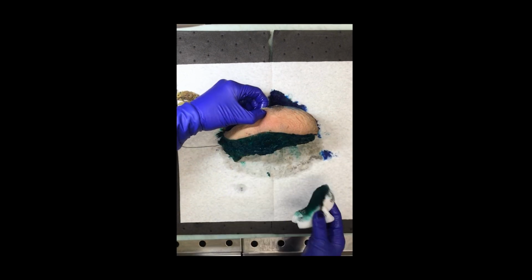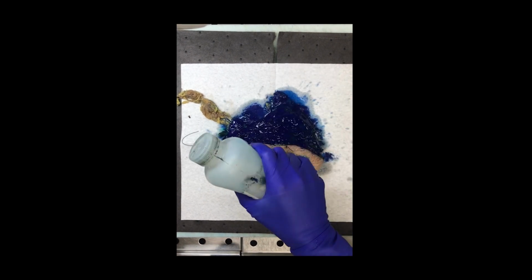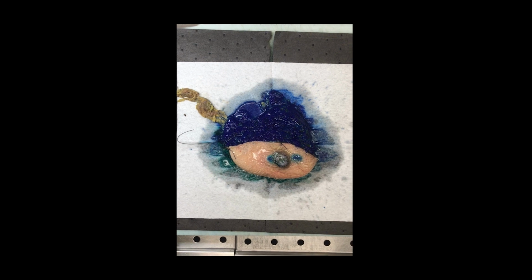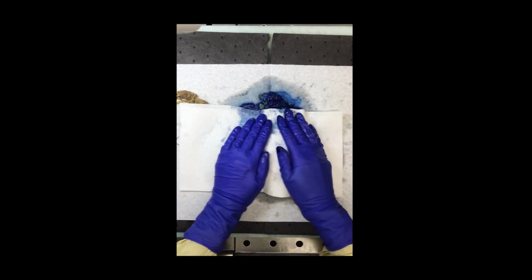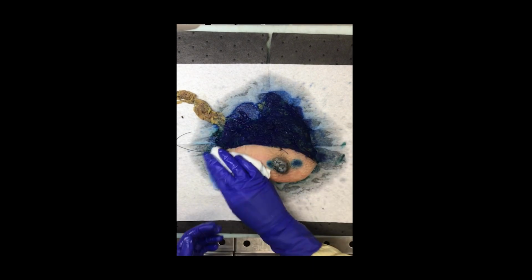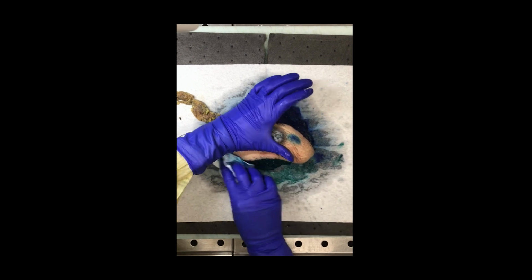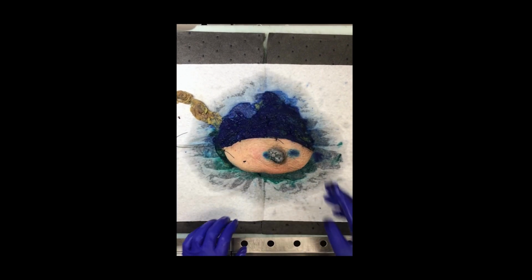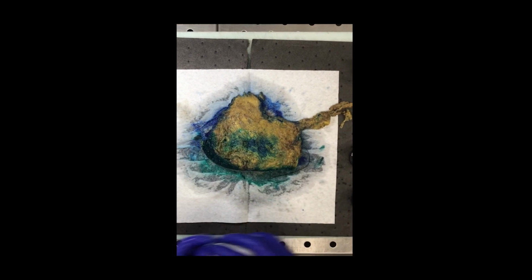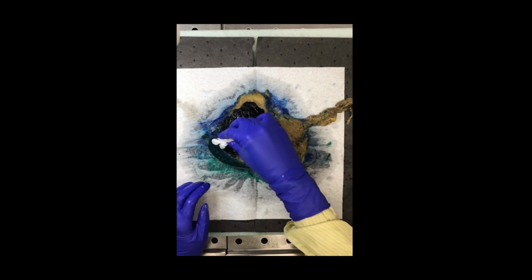With our specimen here, we also have an axillary tail dissection. So this one would be a modified radical mastectomy. So there's a few different things that you can do for inking for this axillary tail. So you can either include it within the blue ink of the superior portion, or you can ink it a separate color. I usually like to do orange if I'm doing it that way. In this case, I just left it uninked so that I allowed the person that will be grossing it the next day to decide how they want to ink it.